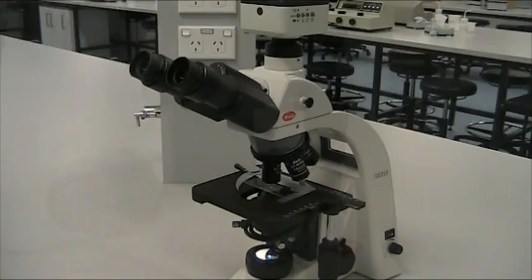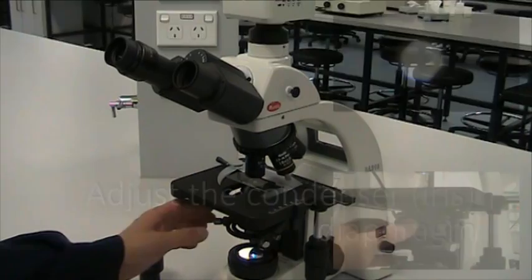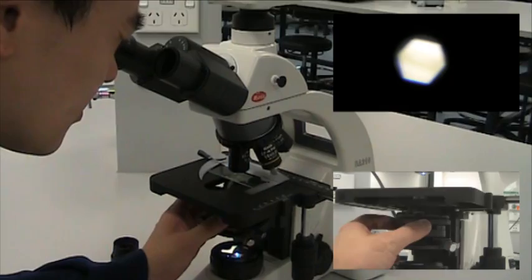To adjust the condenser diaphragm, firmly pull out one of the oculars and look down the tube. Rotate the ring on the condenser to adjust the aperture of the condenser diaphragm until it fills about seven-eighths of the field of view. Put the ocular back firmly.